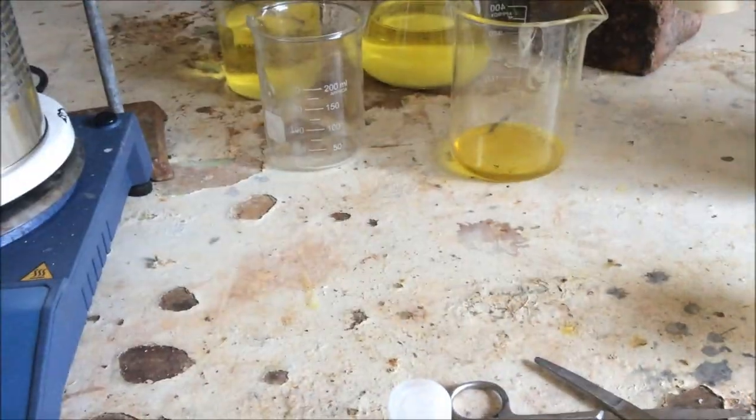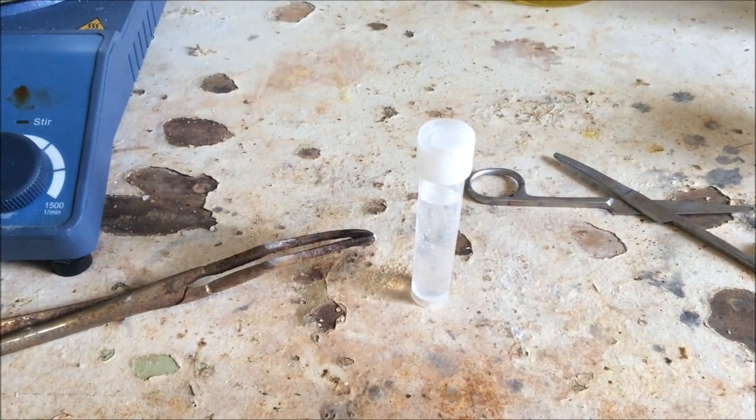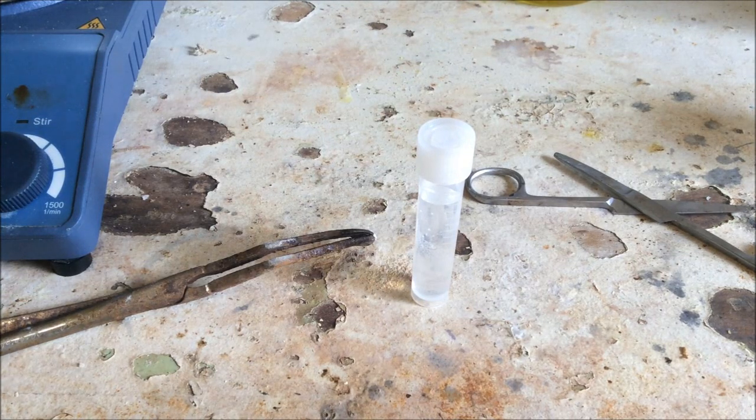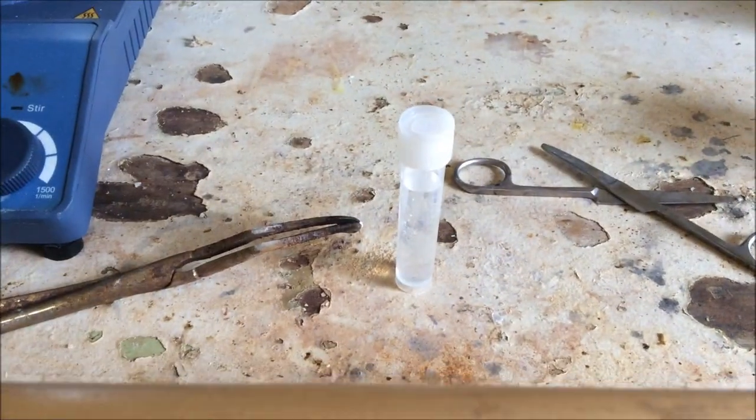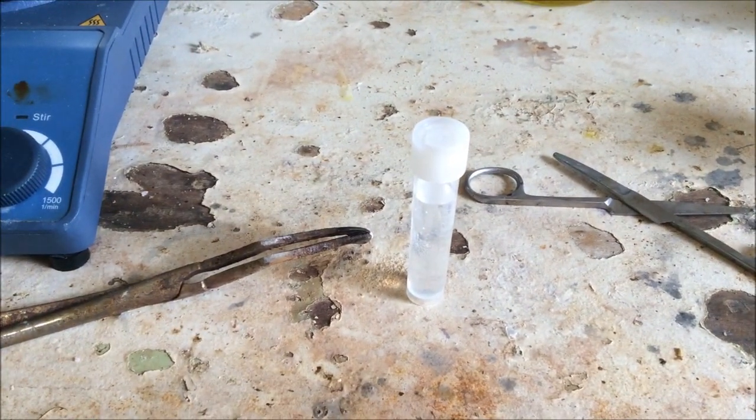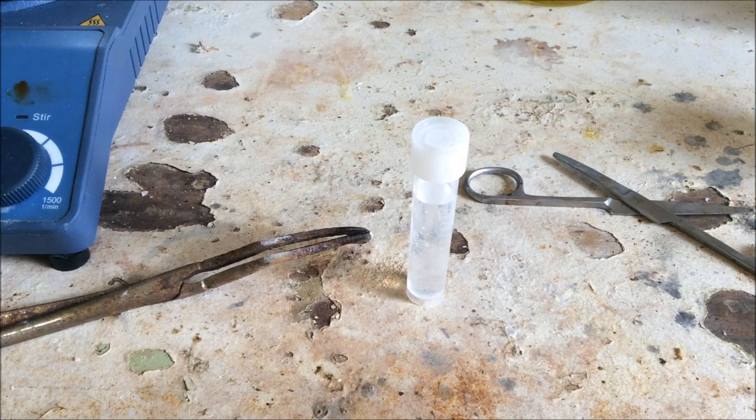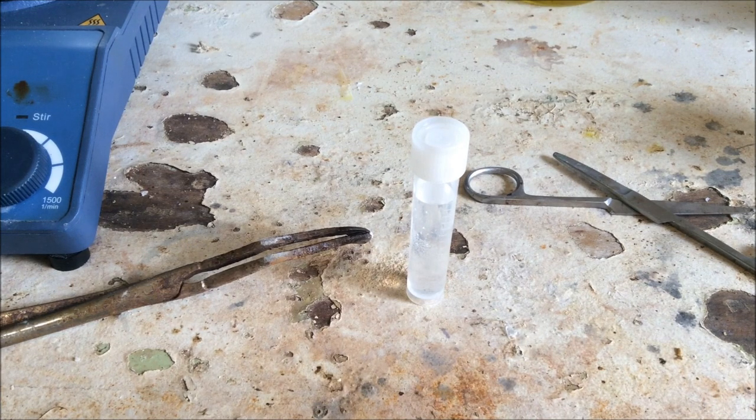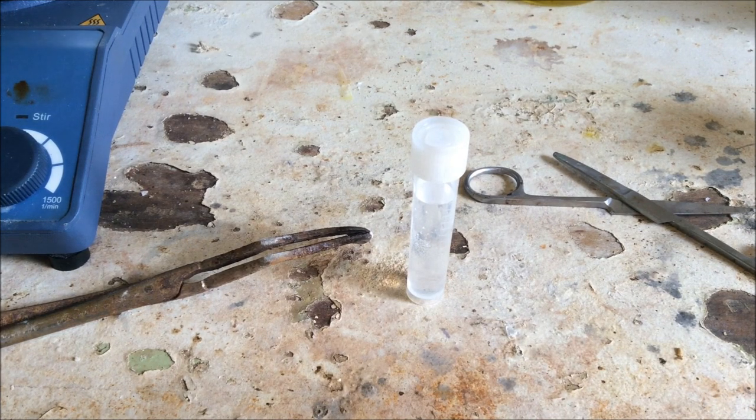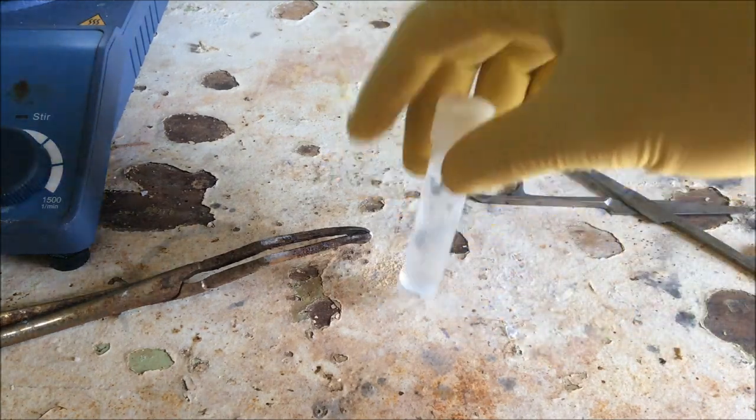I guess that's the consequence of not having any stirring, but I thought the reflux violence would break it all up. I did actually notice this happening about two hours in when I took it apart to stir it. So the reaction was probably complete after two hours, so it probably didn't need to go for the four hours. But I saw that and I thought they were all bits of PET still.